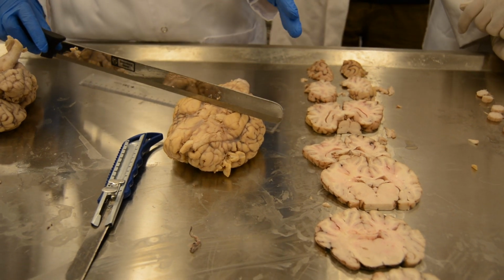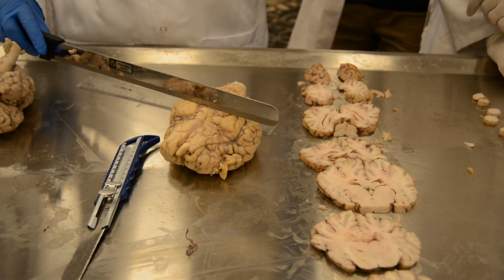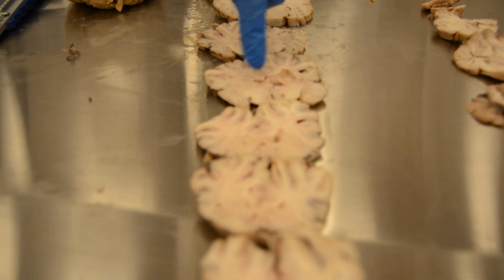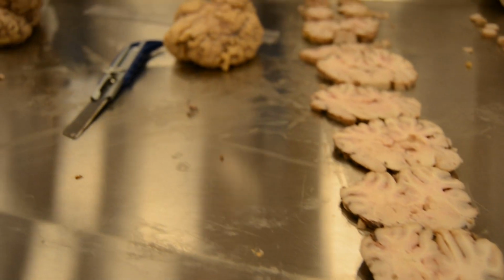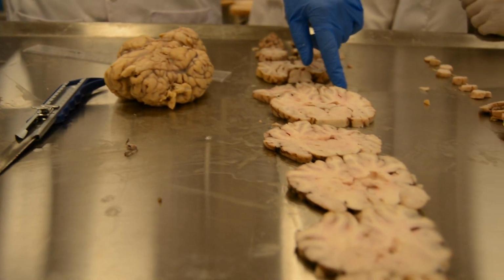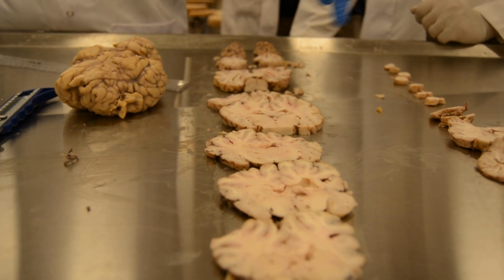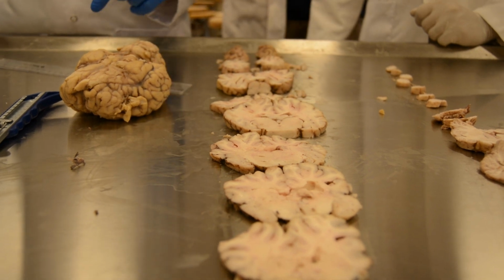In a human brain, I will find the basal ganglia, the thalamus, the hippocampus, the head of the caudate, and the watershed areas 1 and 2. But here, I'll find only the thalamus. The basal ganglia is more to the front. Then the more posterior cuts will reveal the hippocampus. The hippocampus in a cow is bigger. It's nearly circular, surrounding the thalamus.